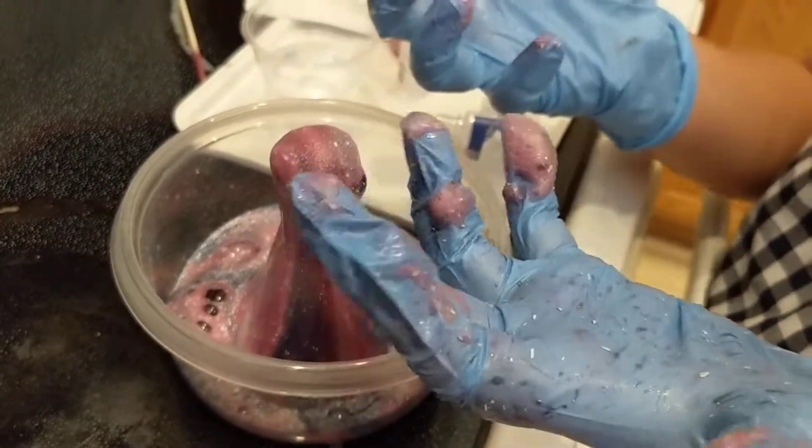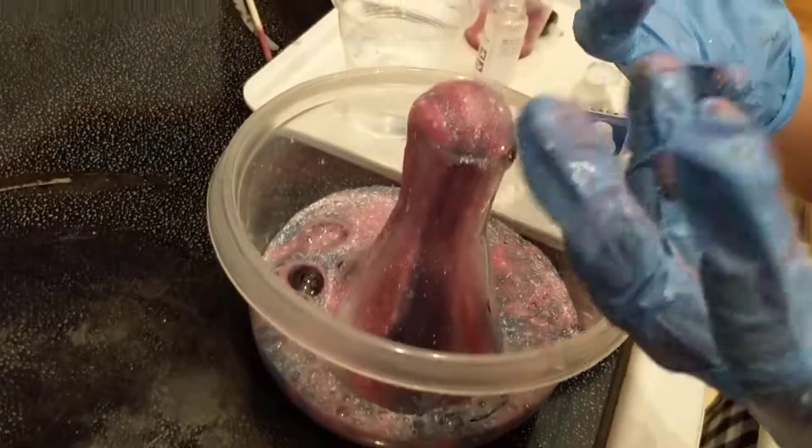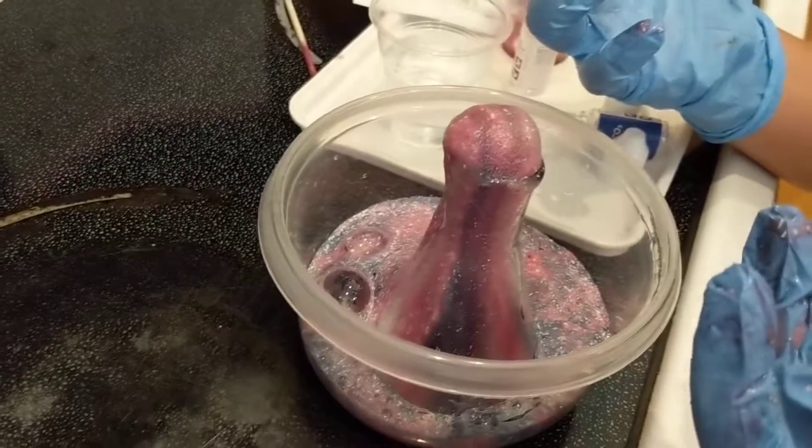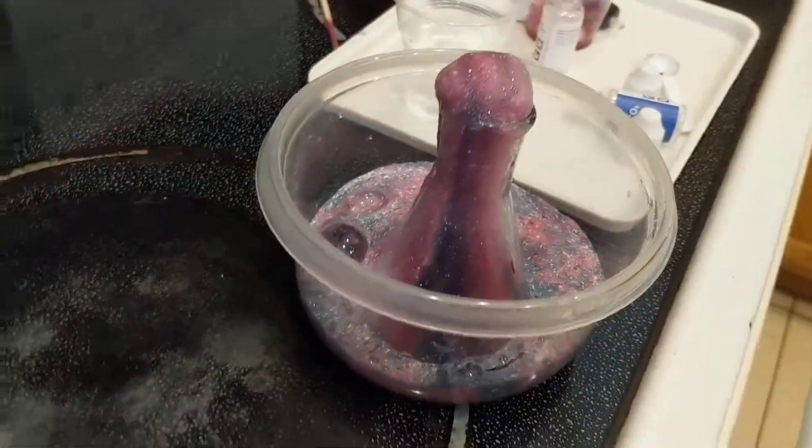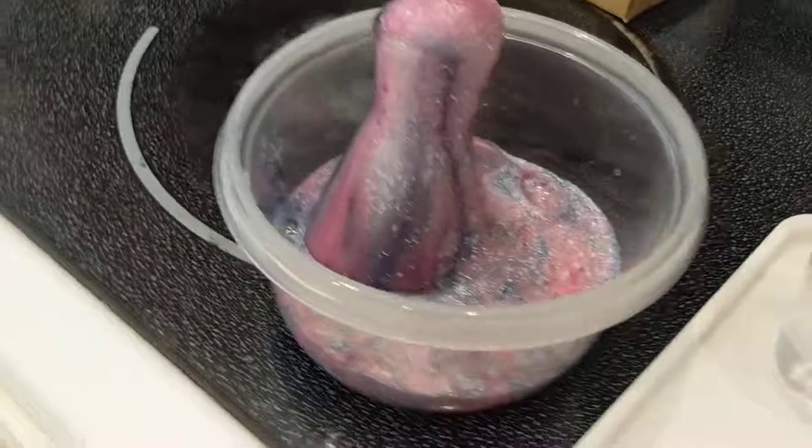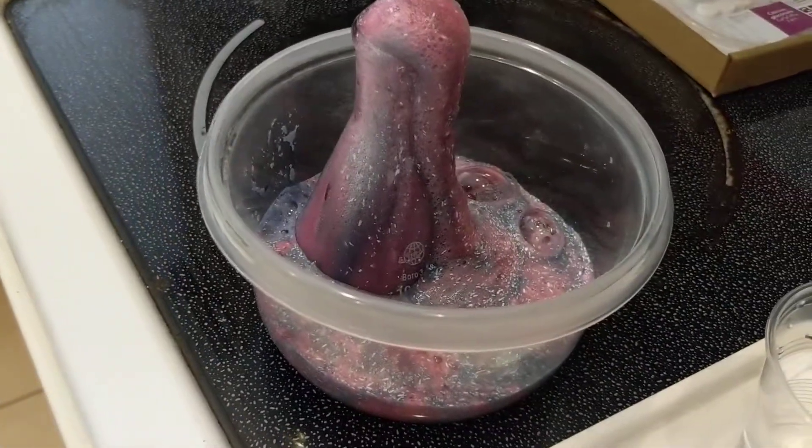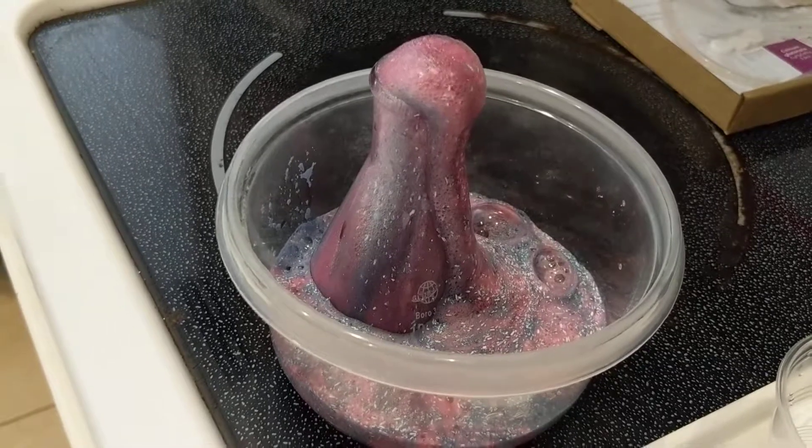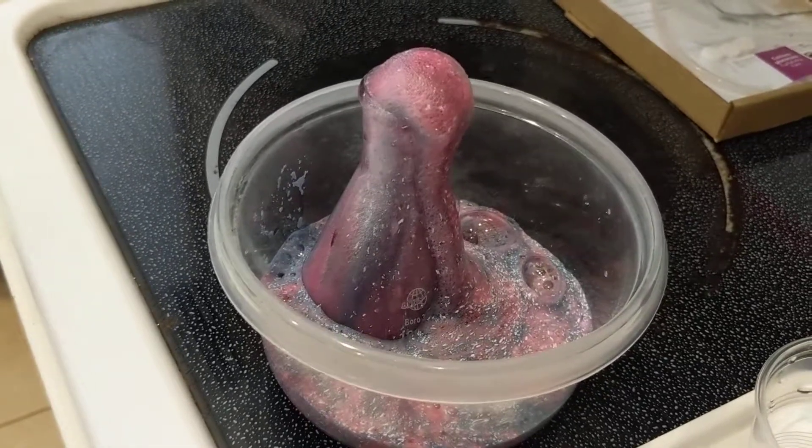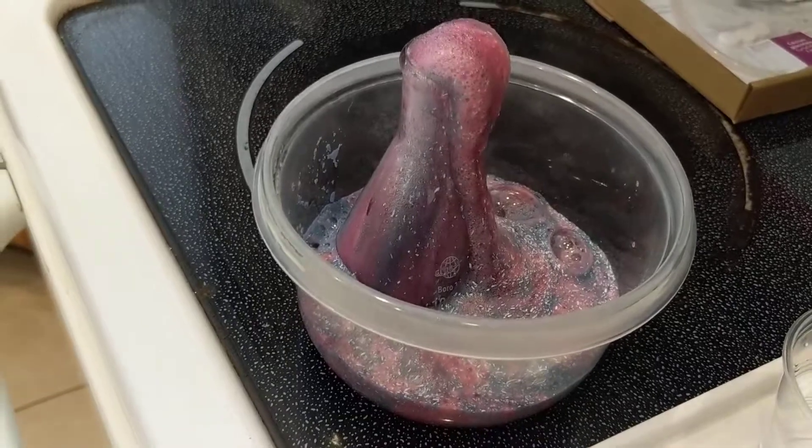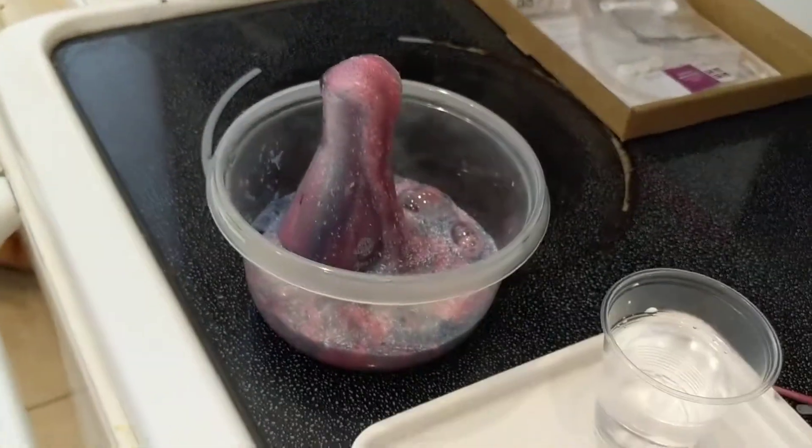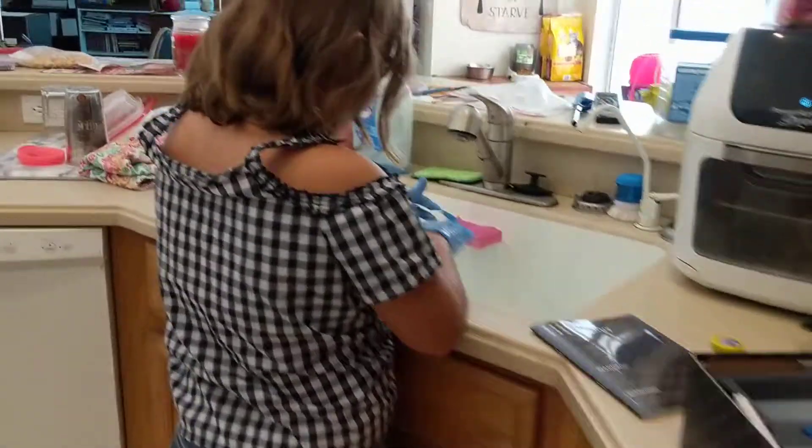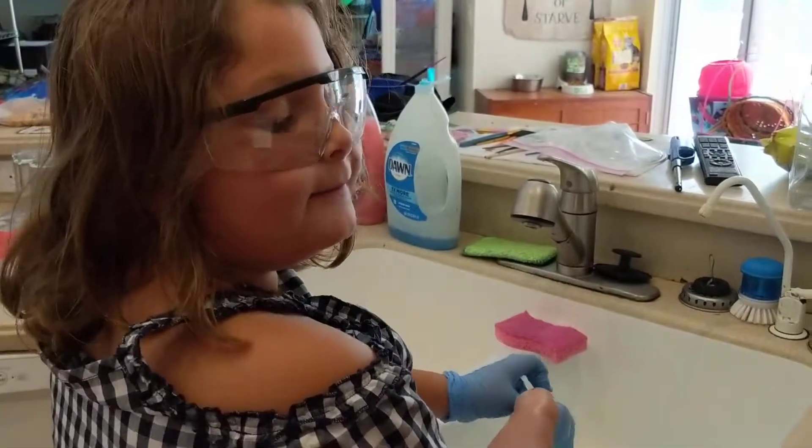Now I need to wash these. Yeah, that's fine. It's still going. It's gonna take a minute. It is really cool looking though. All right, so what'd you think, Cece? I liked it. Yeah, hey cool.